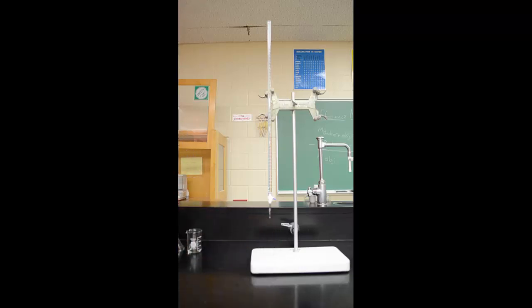Next we're going to replace our waste container with a graduated cylinder, and then we're going to open it up. If I want to distribute, let's say, 10 milliliters, and I started at 20, essentially I'm going to open this burette until I get down to 30 milliliters. So whatever you want to deliver, just add that total to your initial volume, and that's where you need to stop the burette.